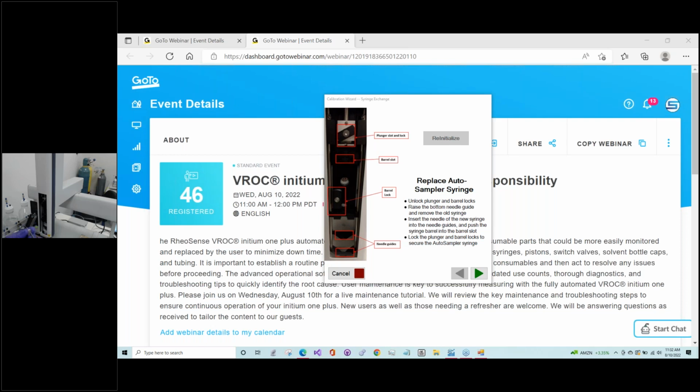Okay. So I checked this piston and I approve of it. So I am going to put it back. What I like to do first is make sure I put the needle back in first. There's two holes that line up here. I'm not sure if you guys could see that. With this guard here and this down here. So what I like to do first is make sure those are lined up and that the needle goes through both of them before I slip the rest in.